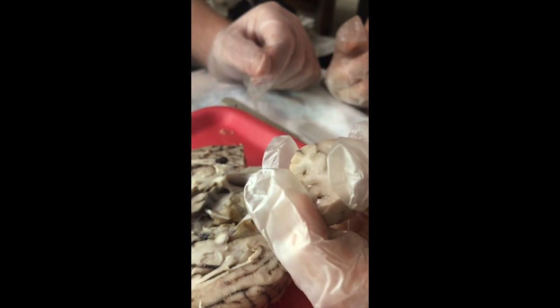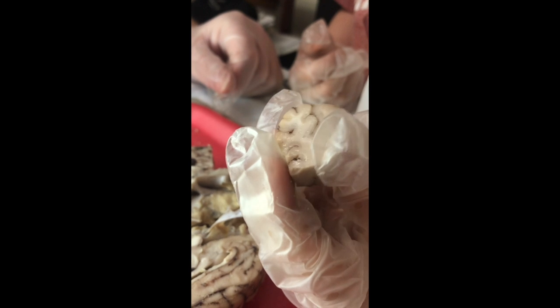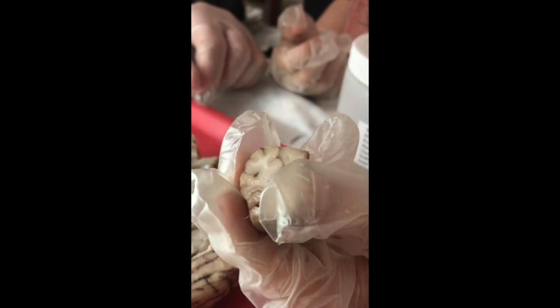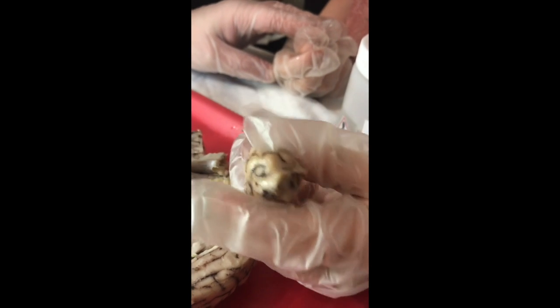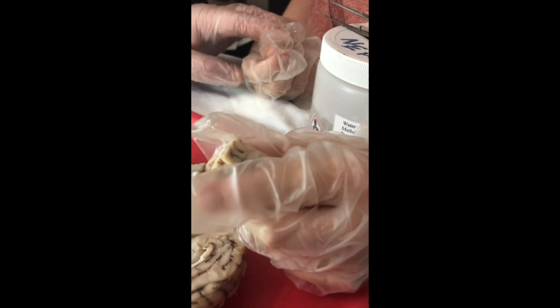One of the considerations with brains, especially in recent years, is the development of concussions and their long-term effects. Those thick meningeal layers are designed to suspend the brain within the cranial cavity, so that as we move around, the brain doesn't bang into the walls of the skull. However, it doesn't stop with sudden stops in momentum, hard blows, and the brain can still impact the walls of the skull. So Tobias is going to go ahead and take his section of brain there and give it a little squeeze.